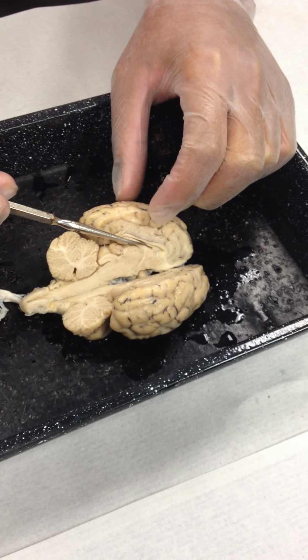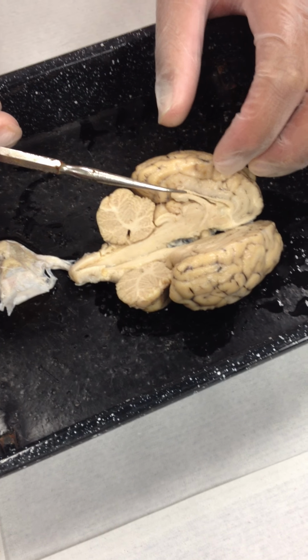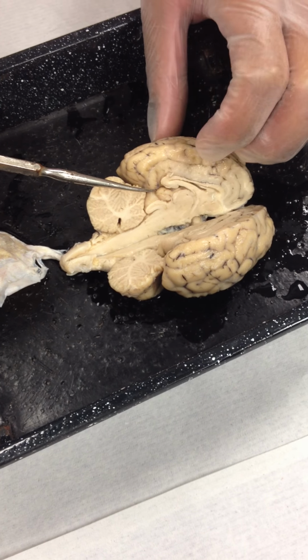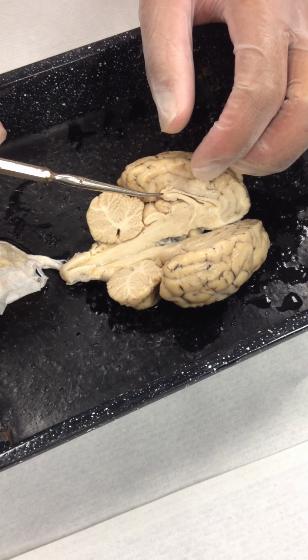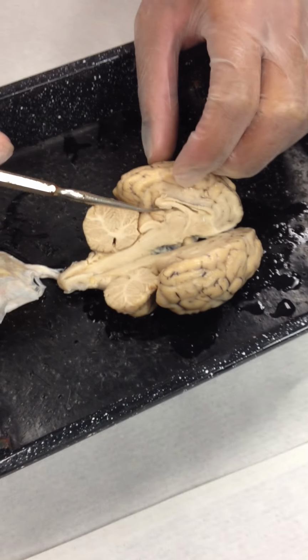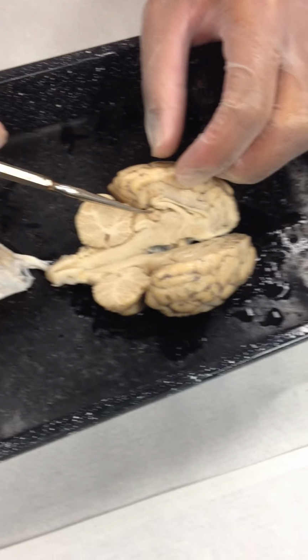The third ventricle then would be a region below this, which if I pull this apart a little bit in here, we can see some of this brownish material is actually within that other ventricle. So there's another cavity or another space right there where the probe is running. We've actually sectioned through the third ventricle, right through the center of it. So we have a half of it in this hemisphere and the other half of it's over there. So it actually comes down and surrounds this entire region. This large structure here passes right through the center of that third ventricle.